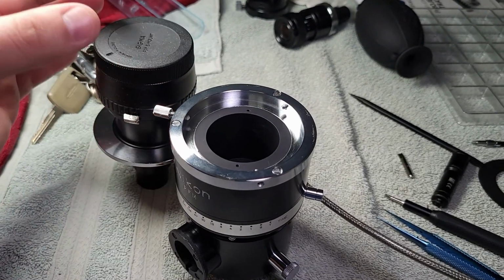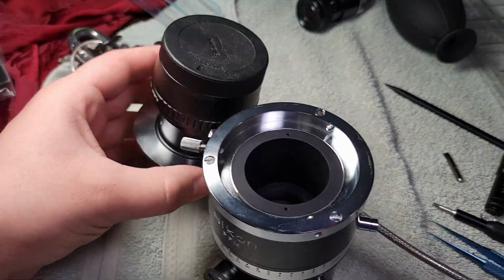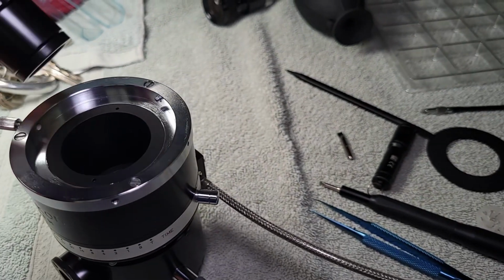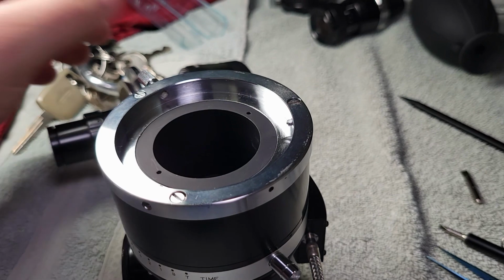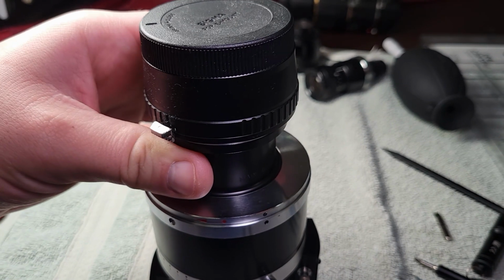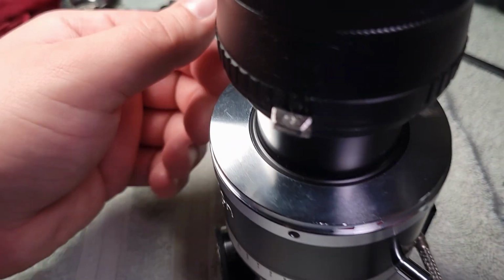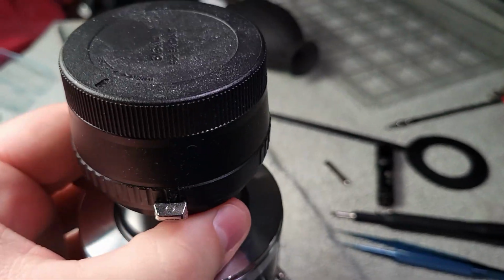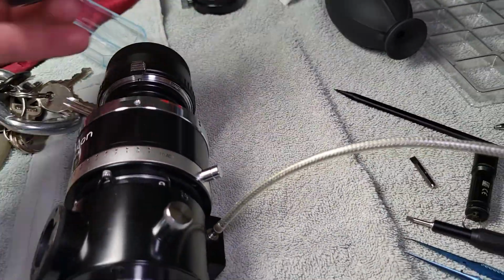So this is the part, this plastic cap unscrews, and in this case, my Sony camera, which is right there, bolts on there, or it clips on. And then there's an adapter here. It goes down to a Nikon F-mount. And then this thing clips on here, and I'm not sure how that goes. I think it goes like this. Oh, you're supposed to line that up after. Okay, yeah. So the red dot goes to the black dot, and then you turn it so the black dots are together. I don't know why they did that. That's kind of a weird way, and then you screw that in to bolt this down, and now it's aligned, I guess.